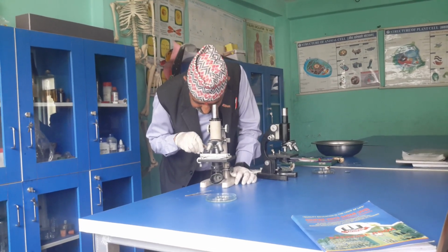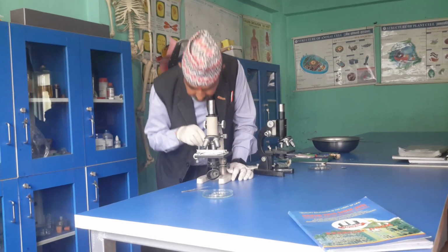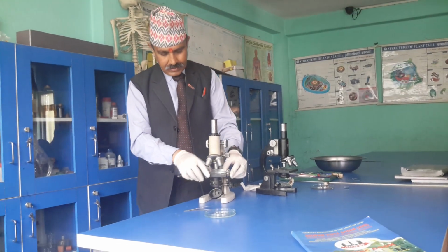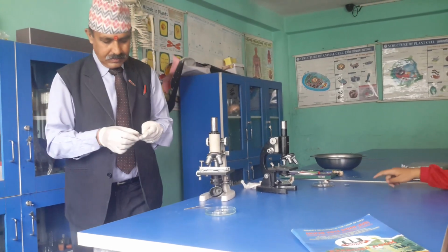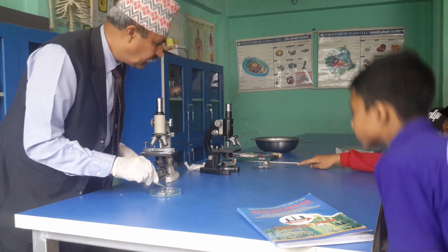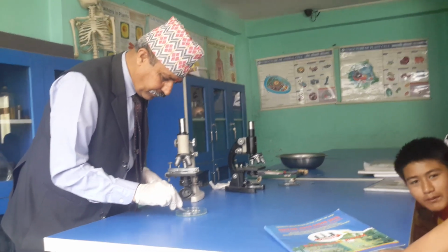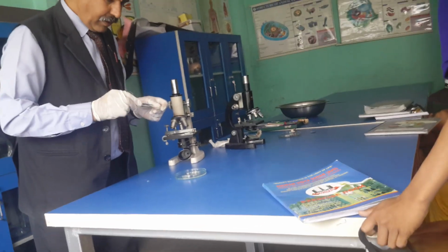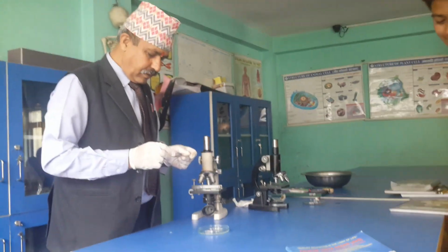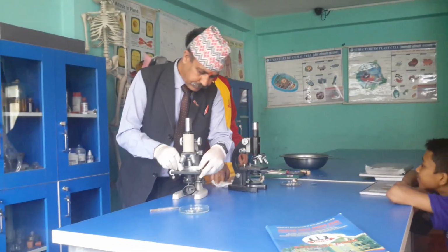Let me take another thing, right? You became very thick, I think. Take very thick, then. Okay, one of you come and just focus there. One can come. Anybody can come and focus, right? If you want to use gloves, use gloves.